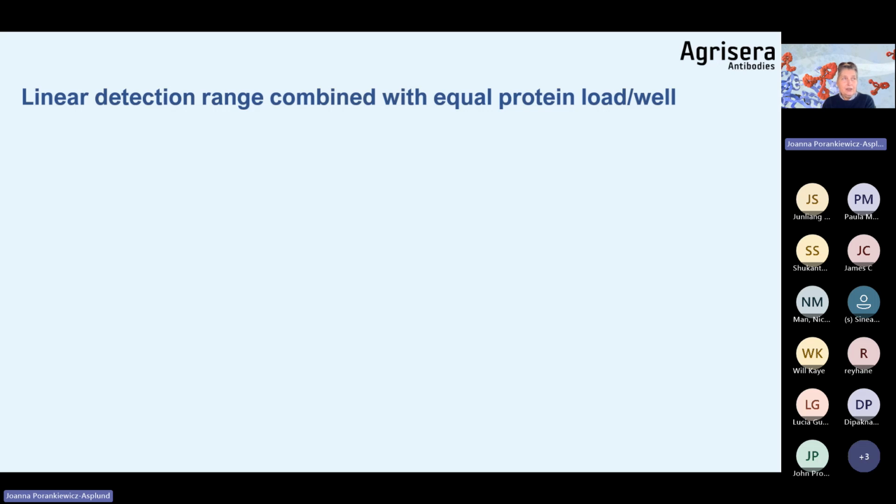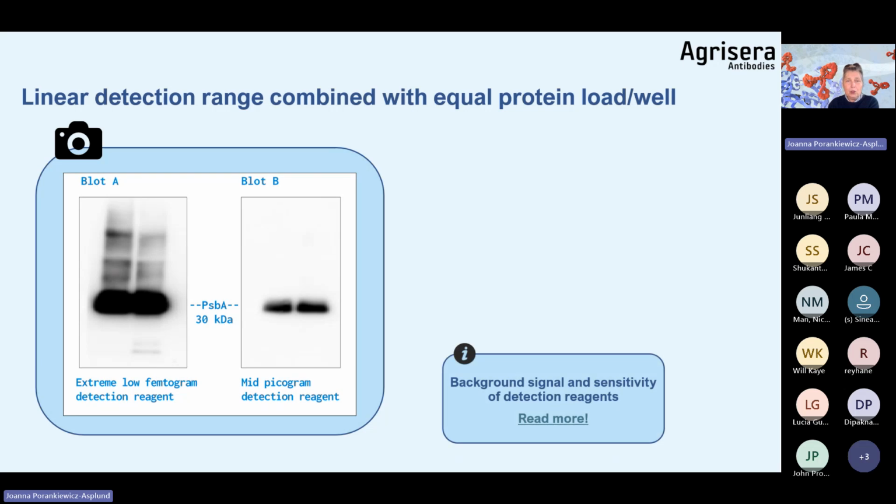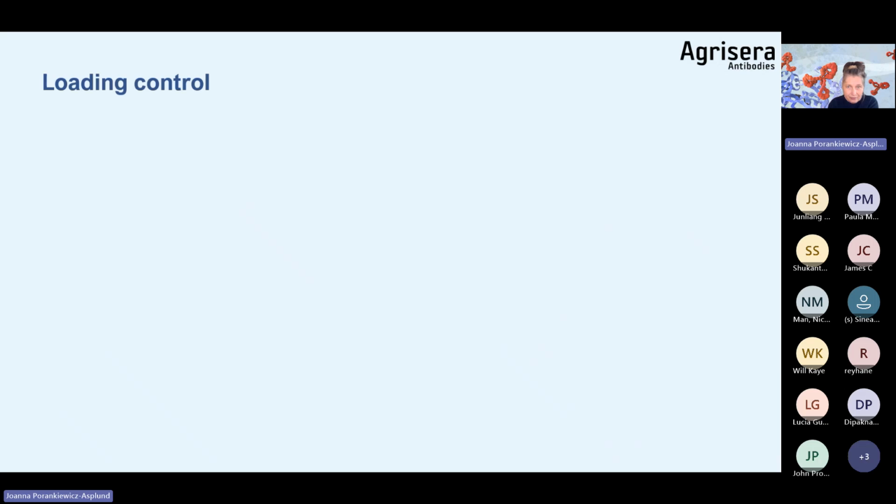We have linear detection range combined with equal protein load per well, and here I want to show you the example where too sensitive a detection reagent was used for the photosynthetic protein of high abundance, PSBA. If a reagent with extreme low femtogram detection range was applied, of course, this is not a linear detection, we get a lot of background, therefore you need to fit the proper detection reagent depending upon how much of your target protein is on the membrane for visualization.